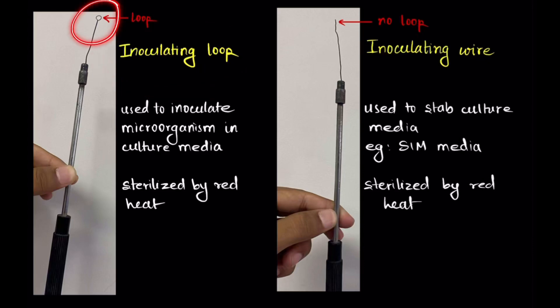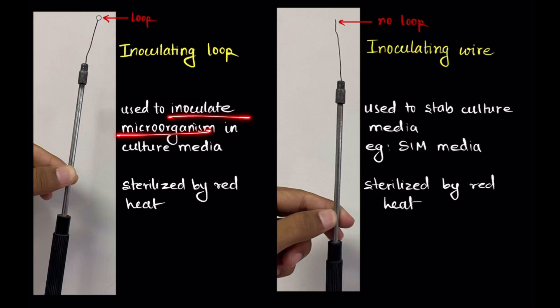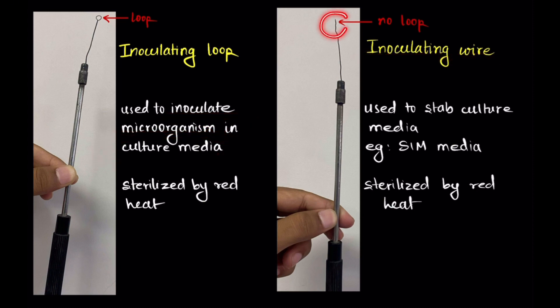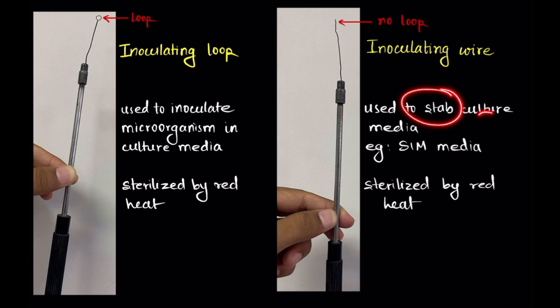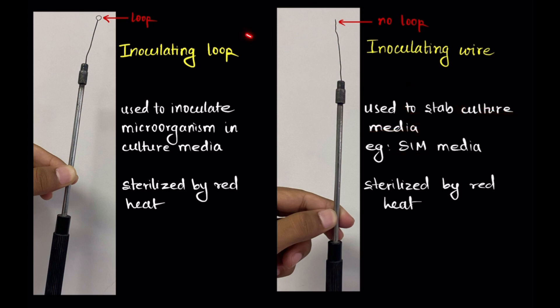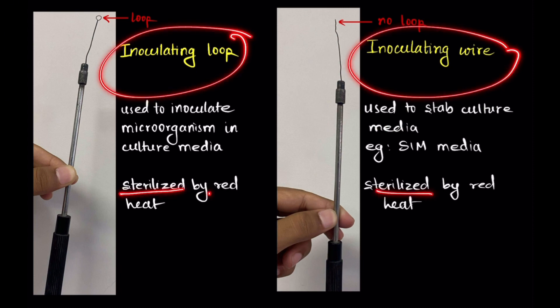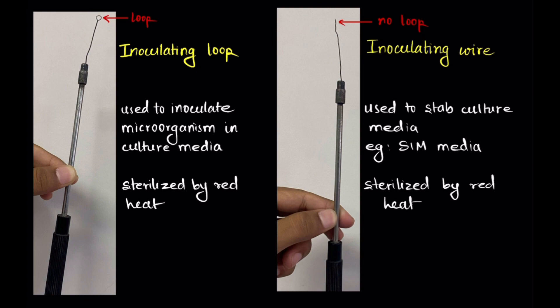Inoculating loop contains a loop at the end and it is used to inoculate microorganisms in culture media. Inoculating wire does not contain a loop at the end and it is used to stab culture media like SIM media. Both inoculating loop and inoculating wire are sterilized by red heat, where they are heated on the flame of a Bunsen burner till they turn red in color.